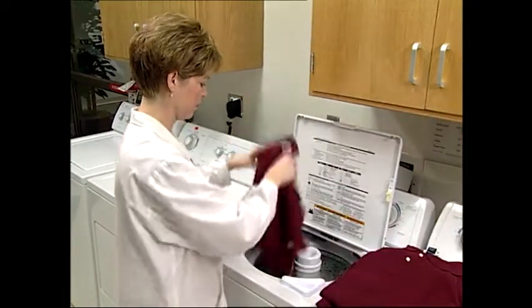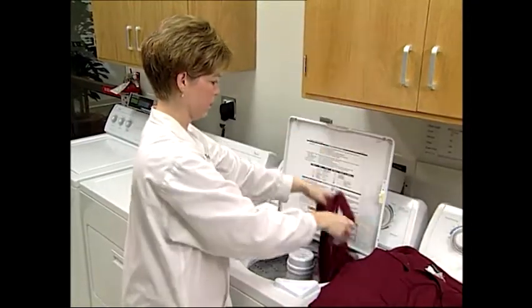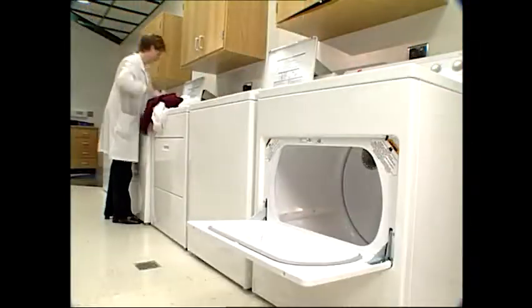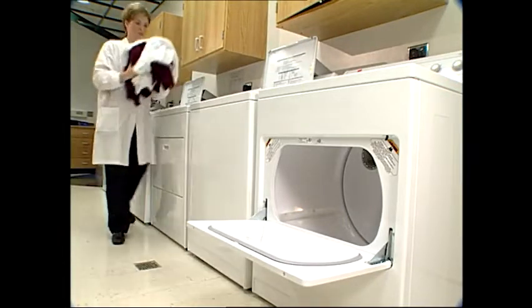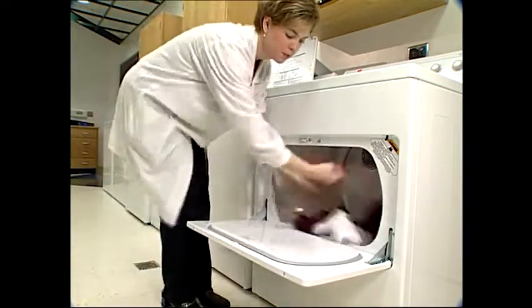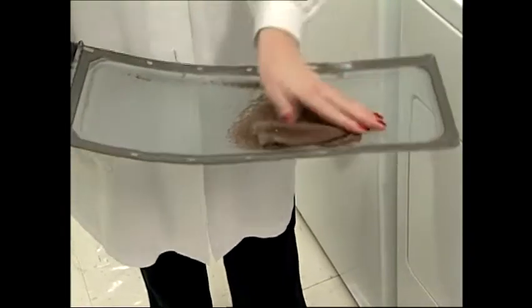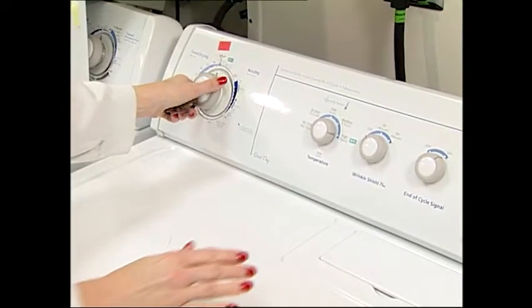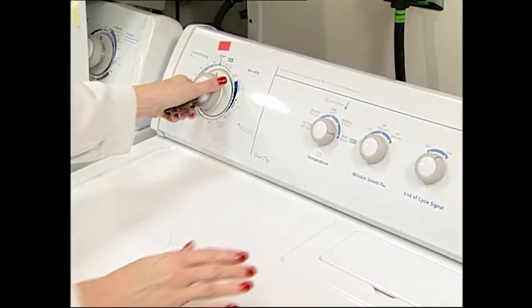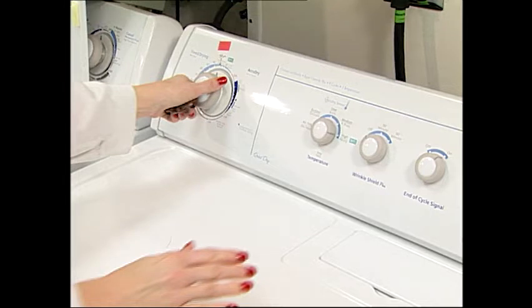Allow sufficient time for the detergent to mix with the water. Next, add the weighed sample load and close the lid. At the end of the wash cycle, transfer the washed sample load into a dryer. Any loose or tangled thread should be cut off at this time. Next, clean the lint filter. Set the dryer for the timed dry cycle at the 30-minute setting. It may be necessary for some heavy fabrics to tumble dry for a longer period.